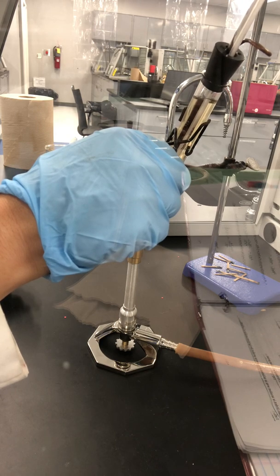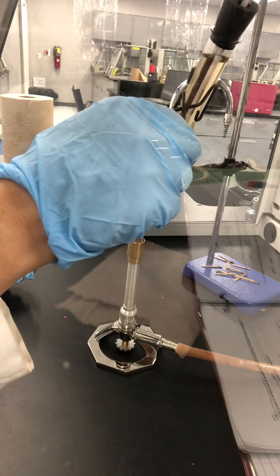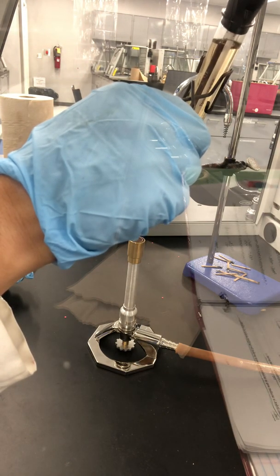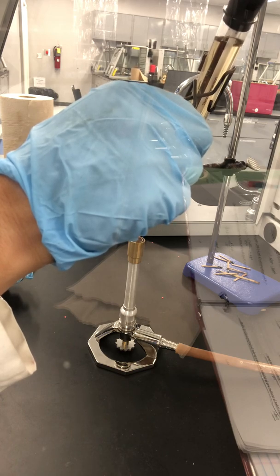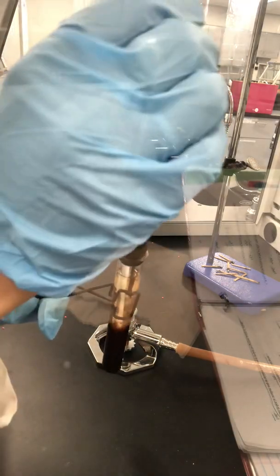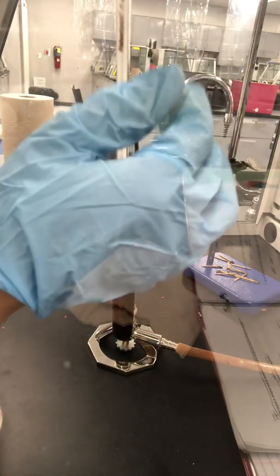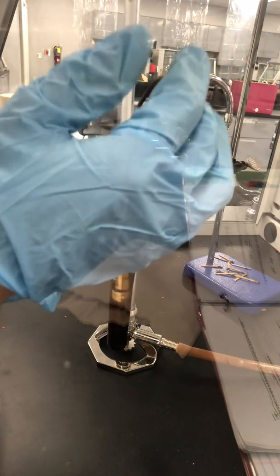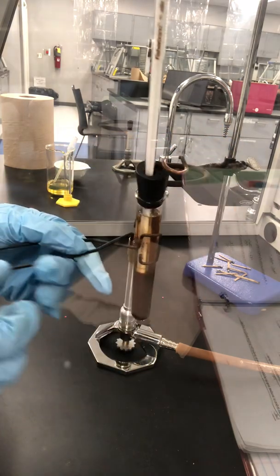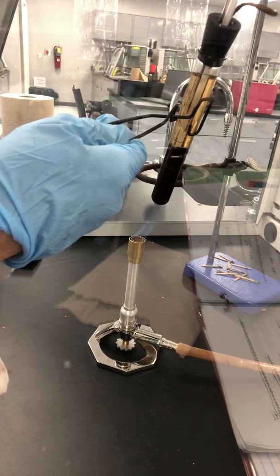Temperature is going up. Now I'm below 40 degrees. It's too fast. Too fast. I'm around 50, almost 60. Okay, let me stir it. I need to stir slowly. I don't want to introduce bubbles. Okay, it's getting better. Now I have to keep raising the temperature. It's almost 60 now.